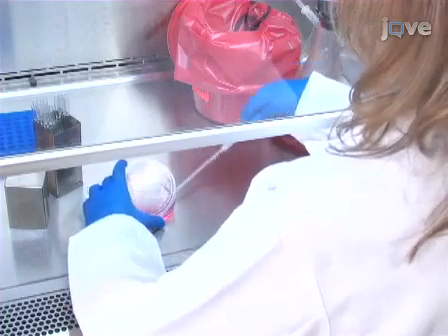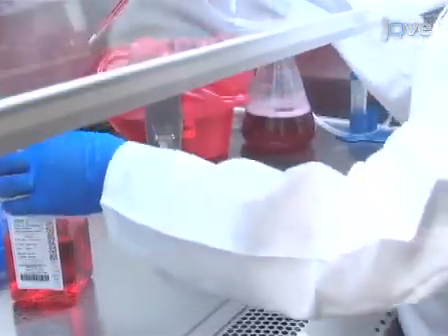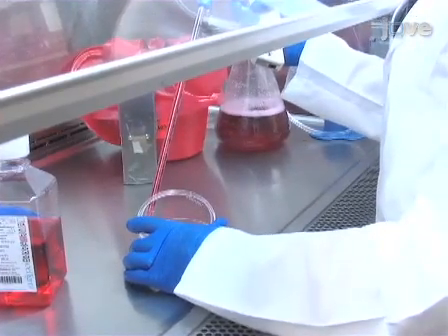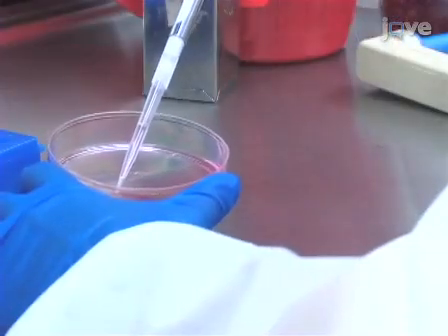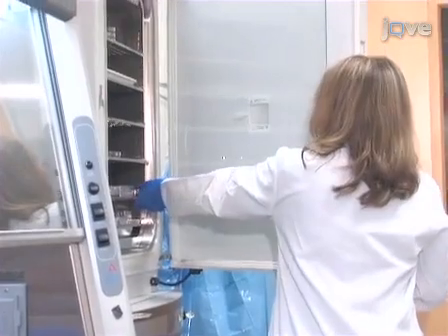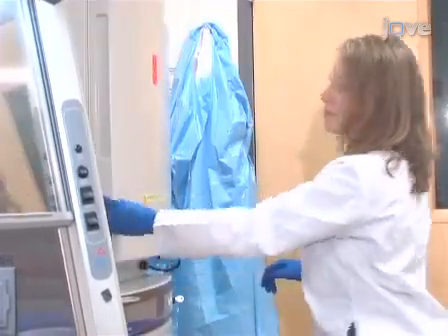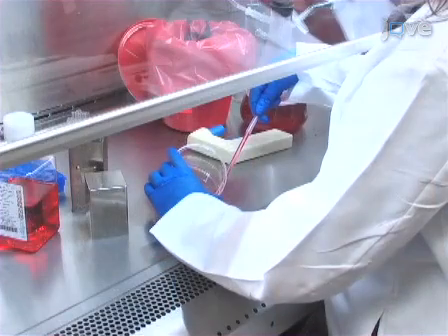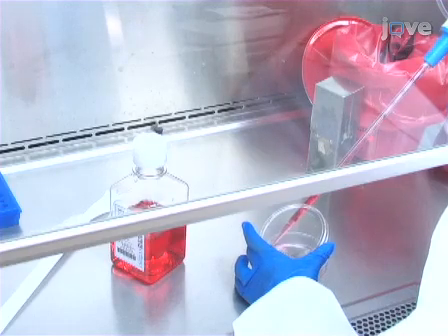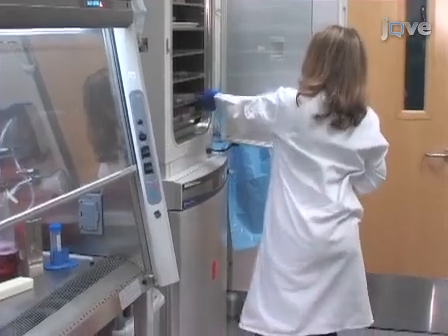During the last few minutes of the incubation, very gently aspirate the media from the plate containing the 293T cells and replace it with 10 ml of fresh, antibiotic-free 293T medium. Finally, add the FuGENE plasmid mix dropwise into the media of the 10 cm plate. Place the plate in a tissue culture incubator set to 37 degrees Celsius and 5% carbon dioxide and incubate overnight. The next day, very gently aspirate the media from the plate and replace with fresh, antibiotic-free 293T medium. Then, replace the plate in the tissue culture incubator and incubate for a further 2 days.